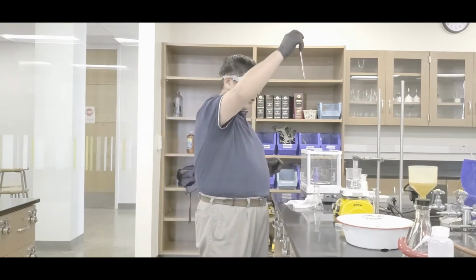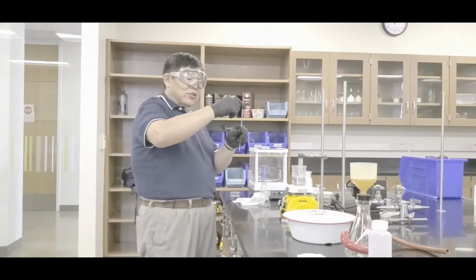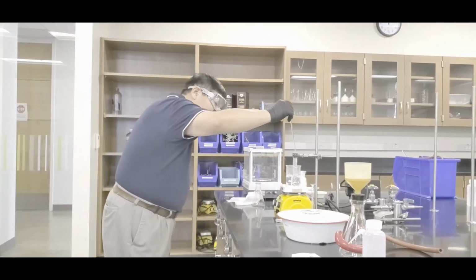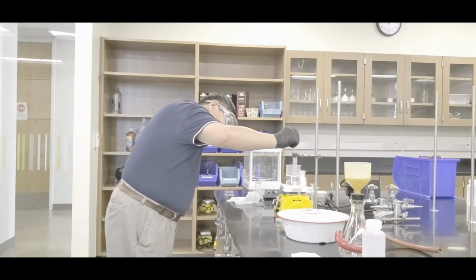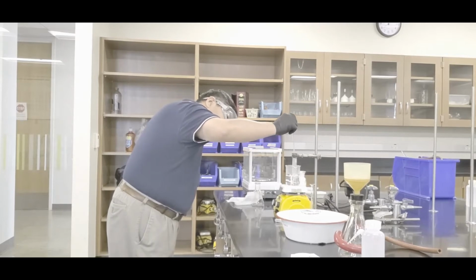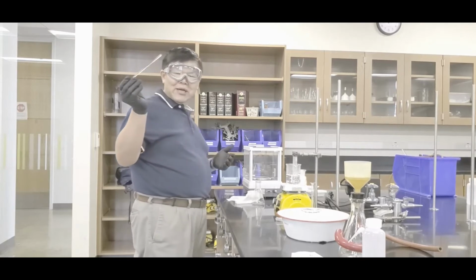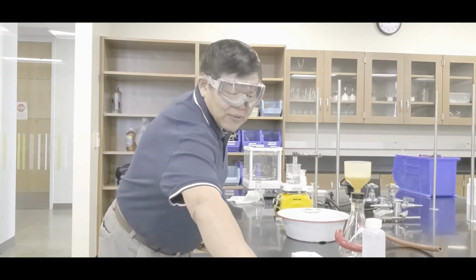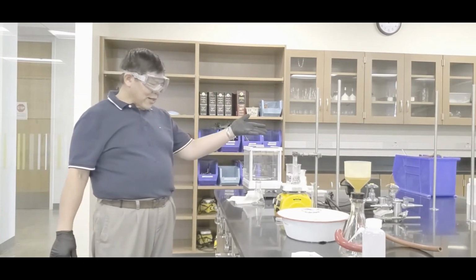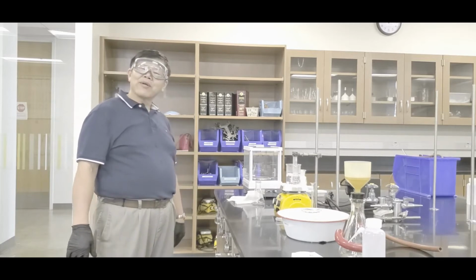And what you want to do is this. You're going to stick it in there, and you're going to stir it this way. Don't jab like that, okay? So stir it this way. So here we go, arm's length away. It's dry, and then you go in there and stir. Okay, so it looks like all that stuff's been dissolved. So let it cook another 5. Hey, you guys, this particular thing right here, park at the edge of the sink. Ooh, it smells like vinegar. All right, so keep it cooking for another 5 minutes. Okay, I'll come back when it's done.